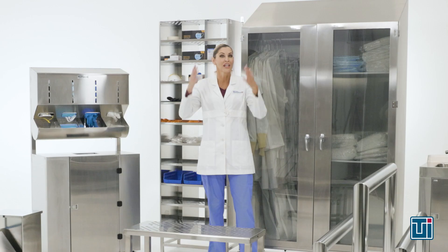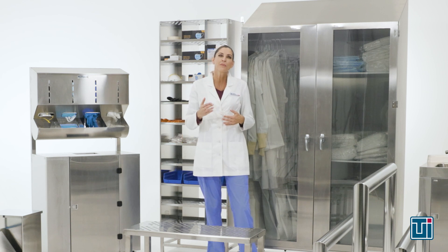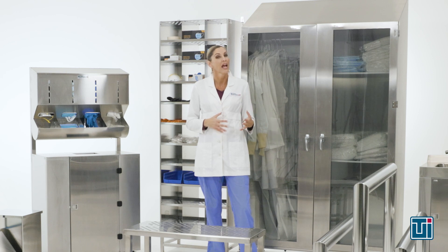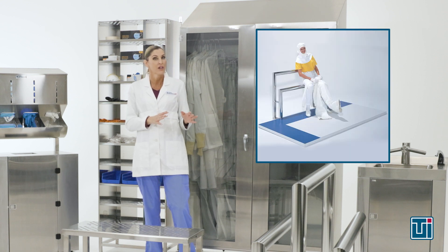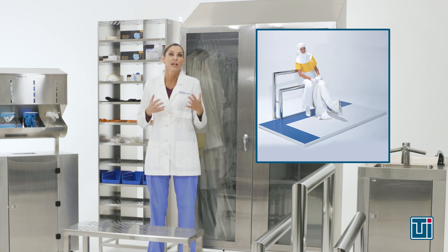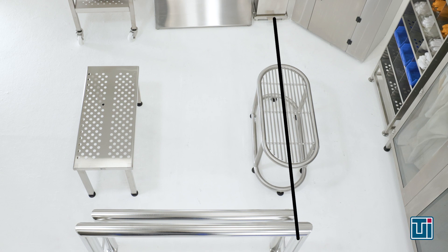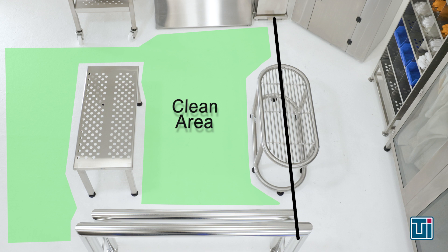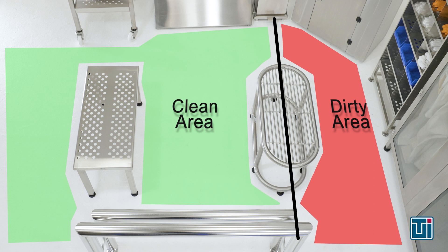Now that your hands are clean, you're ready to gown up — starting at the top and working your way down. A well-designed gowning room will have some kind of demarcation between the clean floor and the dirty floor. For example, Terra's clean room gowning platform explicitly demarcates the clean area in white from the dirty area in blue. In our demonstration area, this bio-safe gowning bench separates the clean side from the dirty side. Only clean laundered booties are allowed beyond the bench.